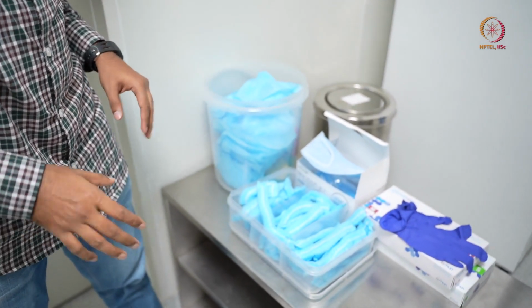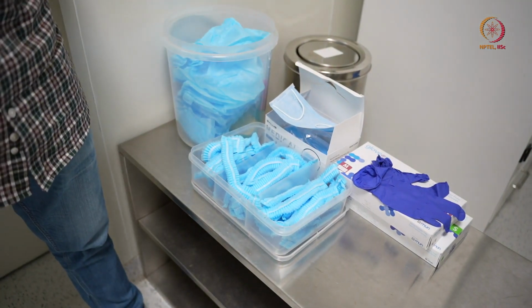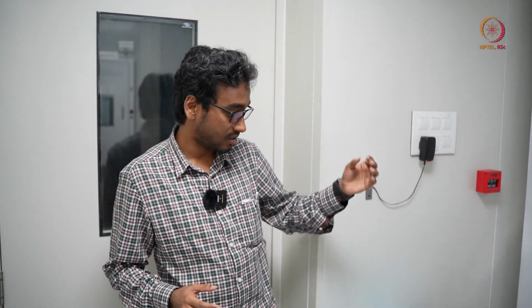So these are the things we have, and we will show how to do it, because for the gowning procedure we have a kind of process, a kind of flow. So we cannot wear one after another just randomly. There are reasons why we are wearing in that particular flow, or why we are maintaining that flow. So my colleague Haripriya is here. She will gown and go inside, and we will discuss at that time which of the PPE should be worn first and why it will be worn in that order.